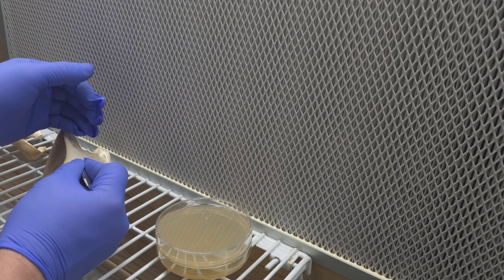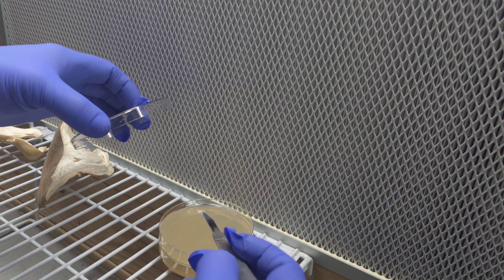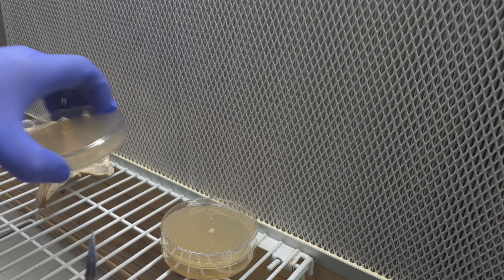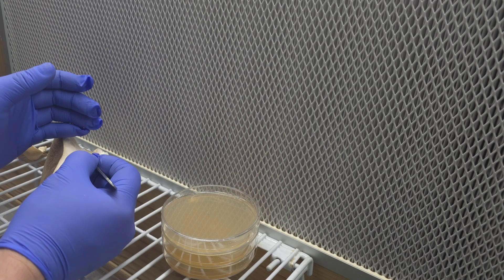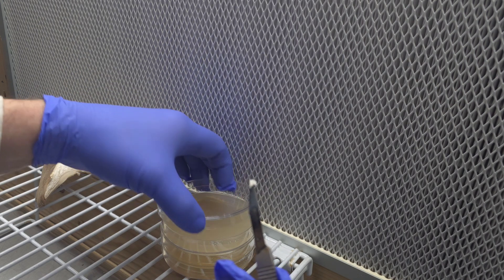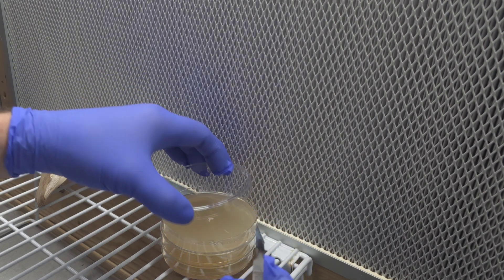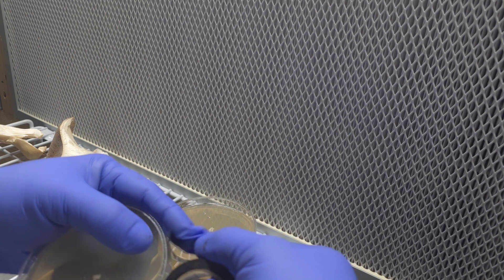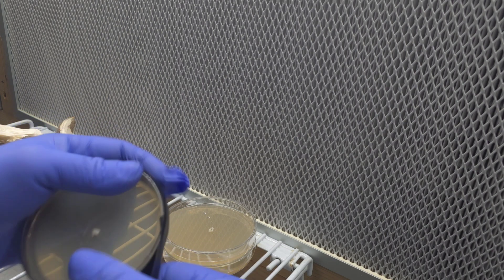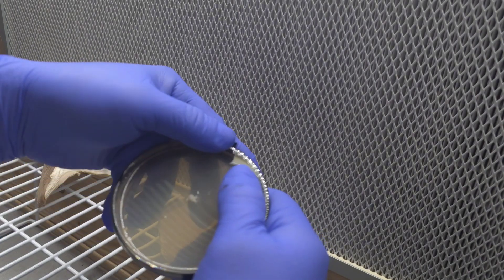When you're working in the lab, you'll develop your own workflow technique that suits your workspace. For myself, I always like to take multiple transfers when doing a clone to make sure we get a nice clean tissue sample. There's that last one — I'm going to tuck it into the agar. Everything went really well; I've got some nice clean samples. Putting the lid on and now sealing them up with electrical tape. It takes about two weeks for the mycelium to fully grow out, and you should be watching the whole time for any molds, bacteria, or yeasts.